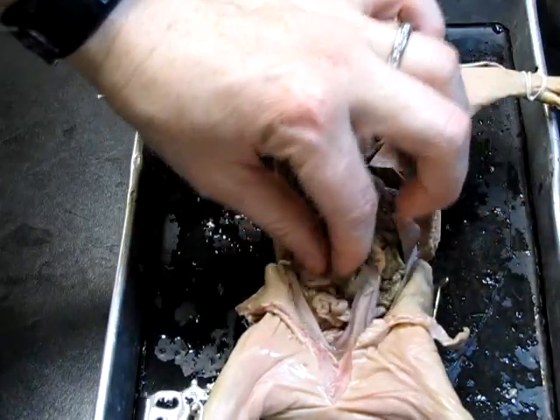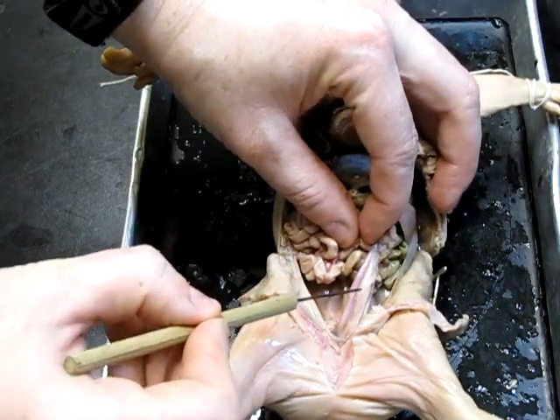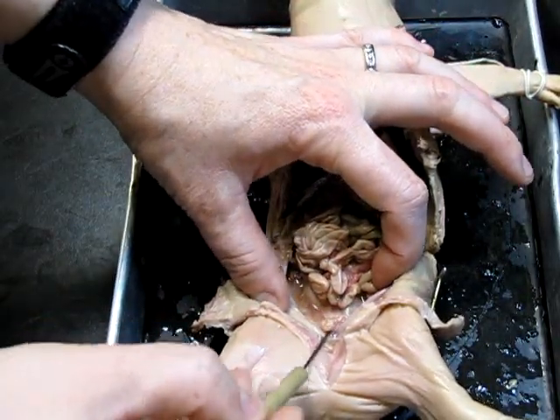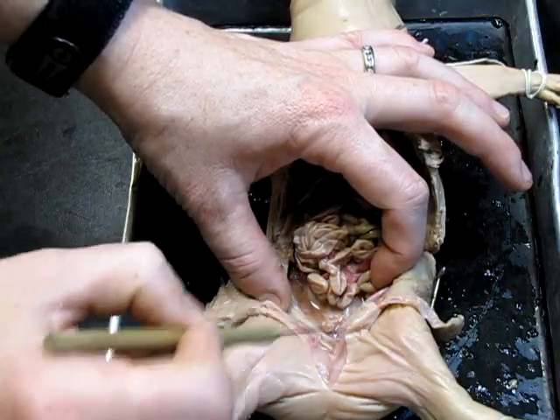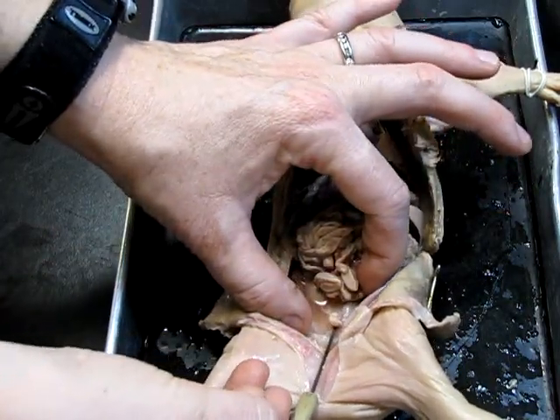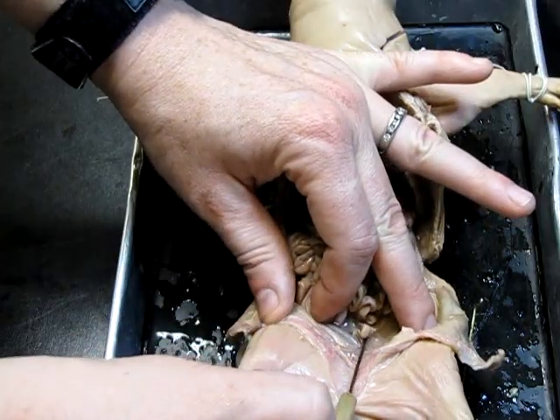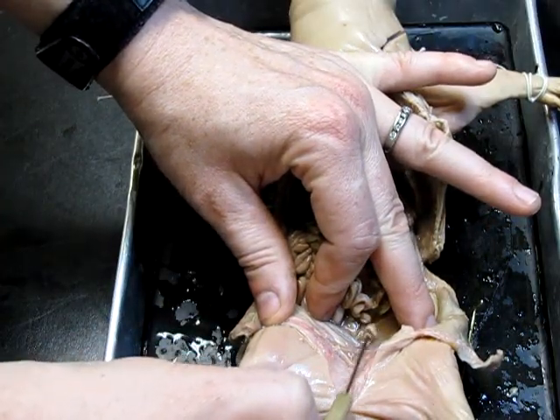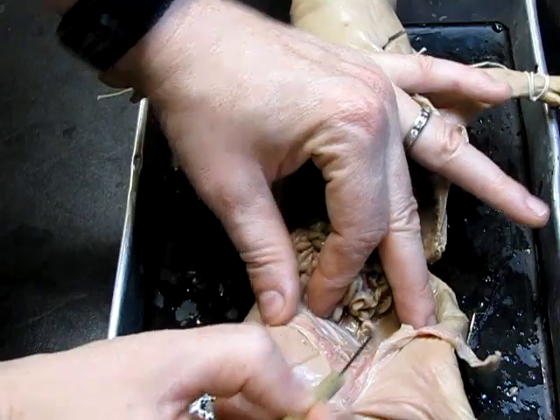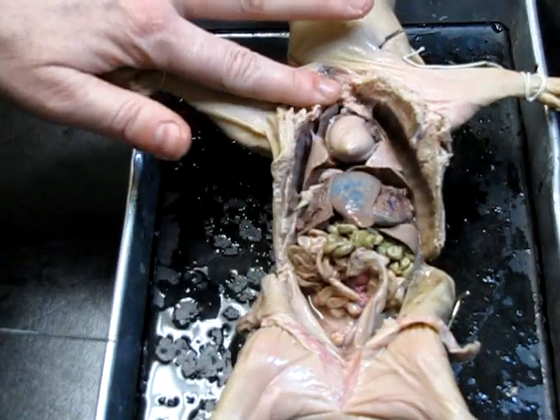The female structures are much smaller and a little less conspicuous than in the male. We need to go down to the base of the bladder and look along the body wall to find the horns of the uterus. The uterus is a V-shaped structure with a main body at the base that branches off to horns on either side. Here we can see one horn of the uterus, and on the other side is the second horn of the uterus. The ovary would be attached to the top of those on either side. Otherwise the animals are identical in terms of their abdominal and thoracic organs.